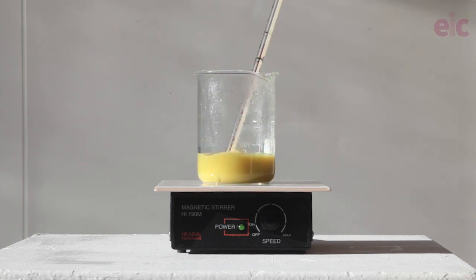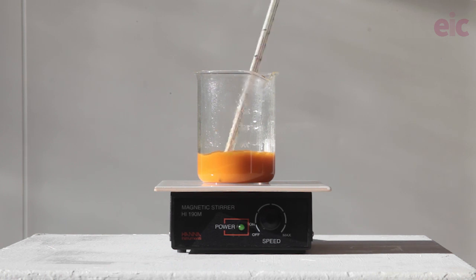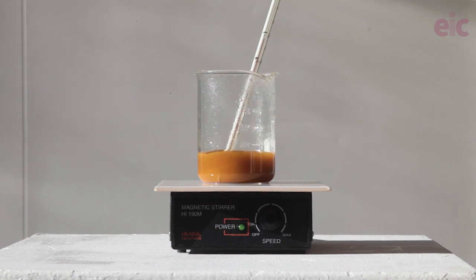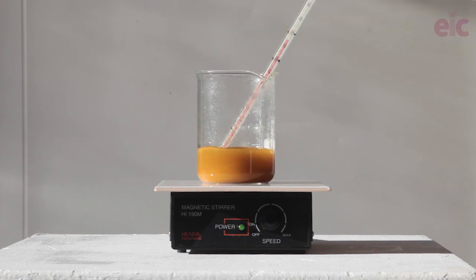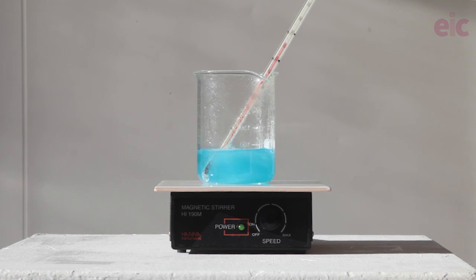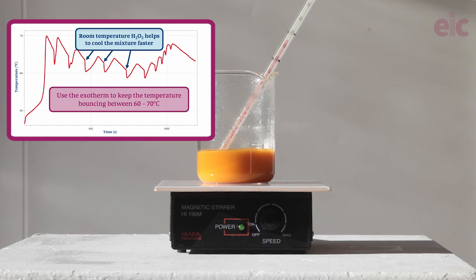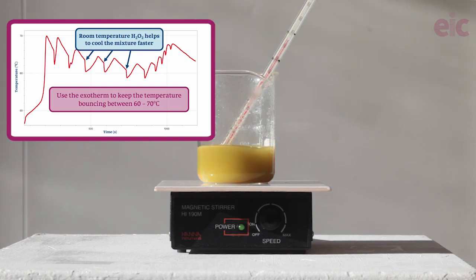With the concentrations and volumes chosen, only a small amount of the tartrate is consumed on each round, meaning further additions of peroxide can re-oxidize the copper back up to copper(II) and start the process all over again. Temperature management is crucial for a good effect — that's why I kept the rest of the peroxide at room temperature. If it were heated, the next exotherm would potentially push the solution above 70°C, at which point the cycling becomes inhibited. We want to keep it between 60 and 70°C by riding those exotherms. Adding 10 ml of peroxide drops the temperature from near 70 back into that sweet zone.